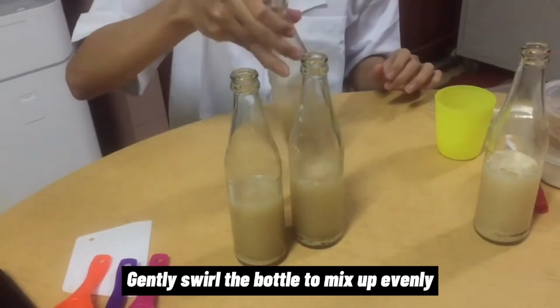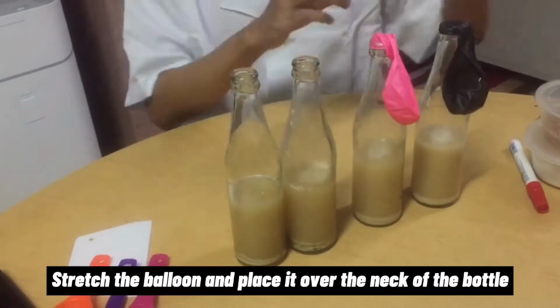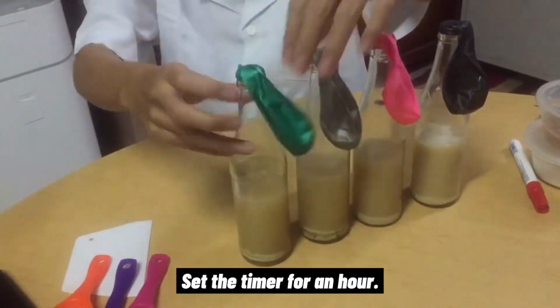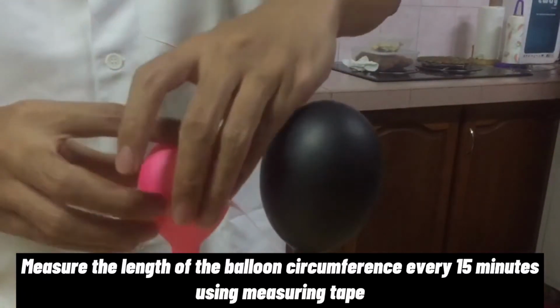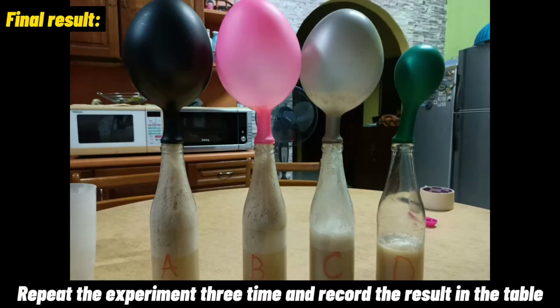Gently swirl the bottle to mix up evenly and stretch the balloon and then place it over the neck of the bottle. After done, set the timer for an hour and then we need to measure the circumference of the balloon using measuring tape every 15 minutes and then record the results in the provided table.